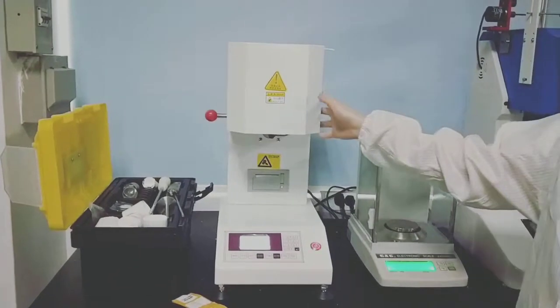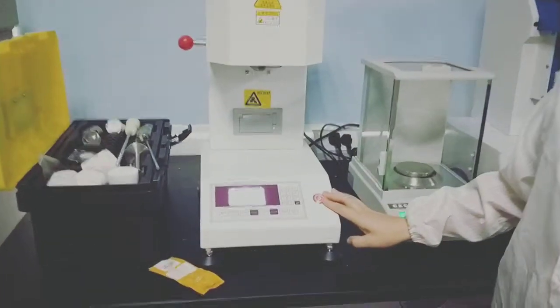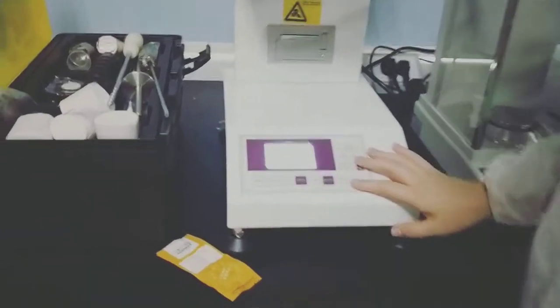This is the main frame of the machine. This one is the power switch, and here is the control panel.